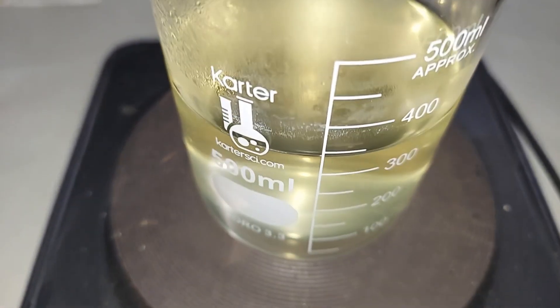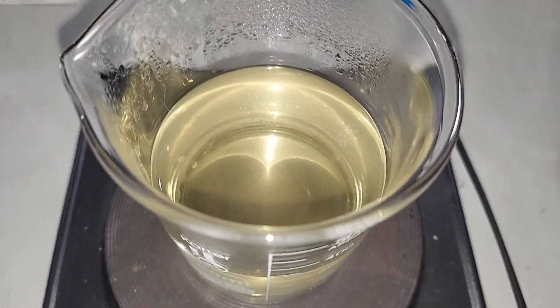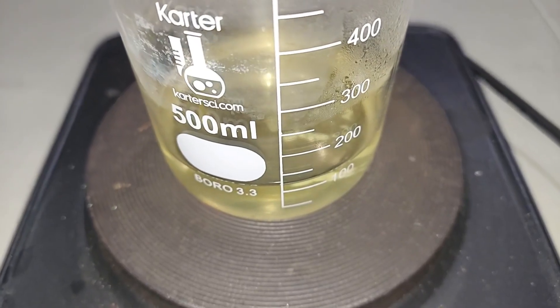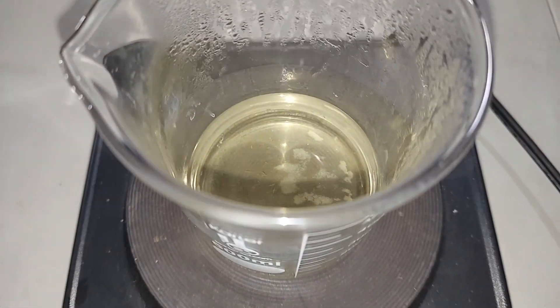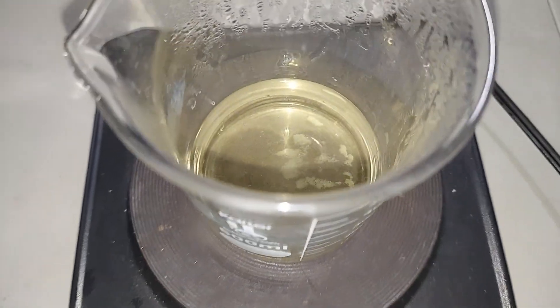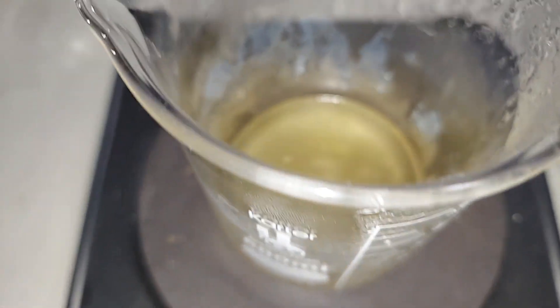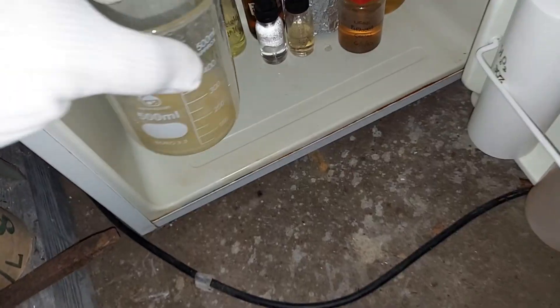Interestingly, the first 100 mL evaporated and some dark substance started to come out of solution, so I hot-filtered it at that point. When we were at about 250 mL I let it cool to see if crystals would form, but they didn't. So I continued heating — starting from over 575 mL, we're now down to almost 100 mL and you can clearly see there are crystals at the bottom. Our solution is down to about 25 mL and crystallization is starting to take place on the surface. I'm going to turn off the heat and put it in the fridge.